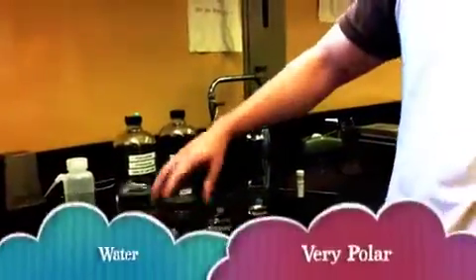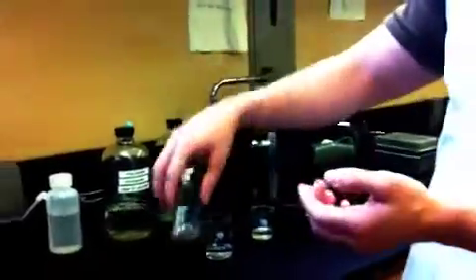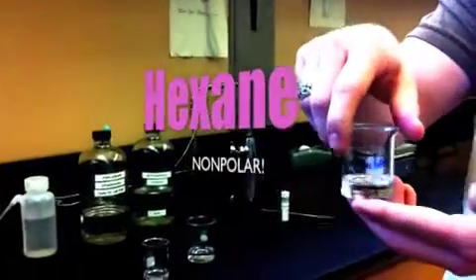So we have... Can you see that print with the dark background like that? So we have water, there you go, ethanol, and hexane.